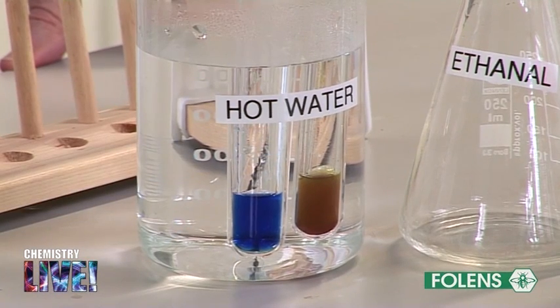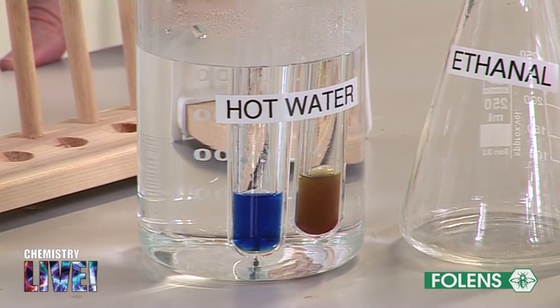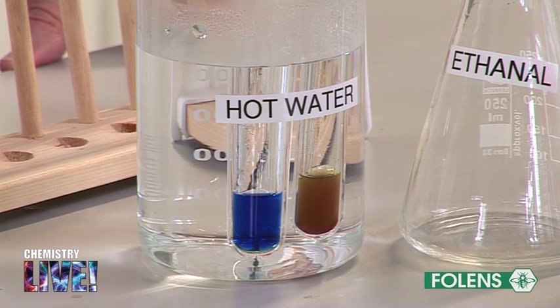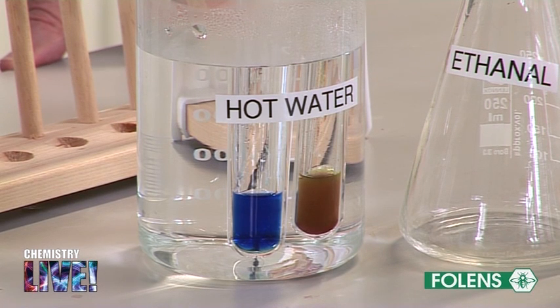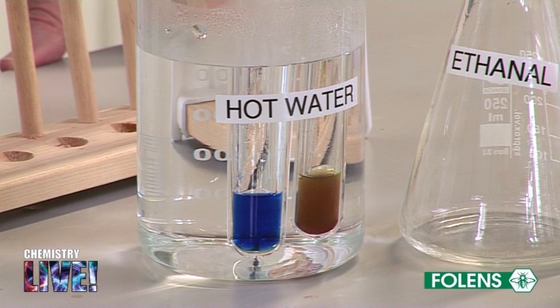Note that there is no colour change. With the aid of your textbook, explain your observation. This concludes this part of the experiment.